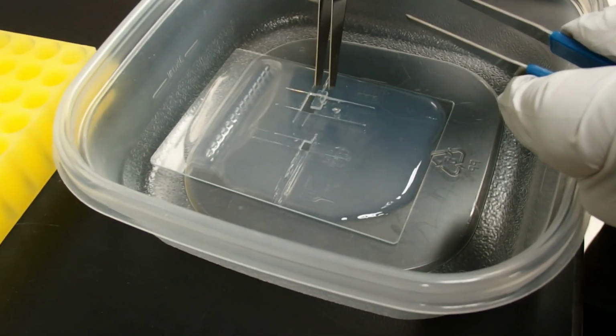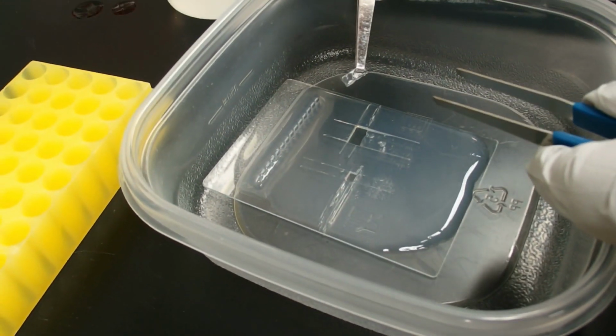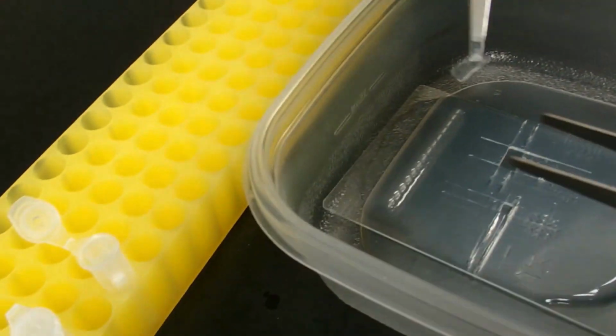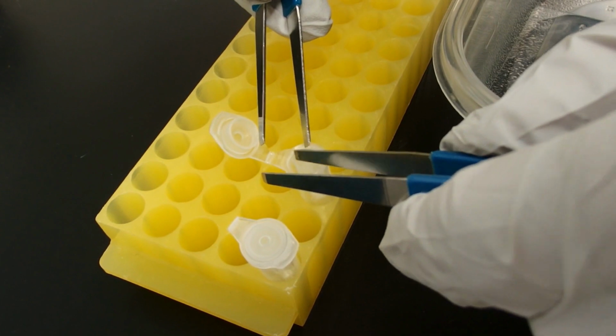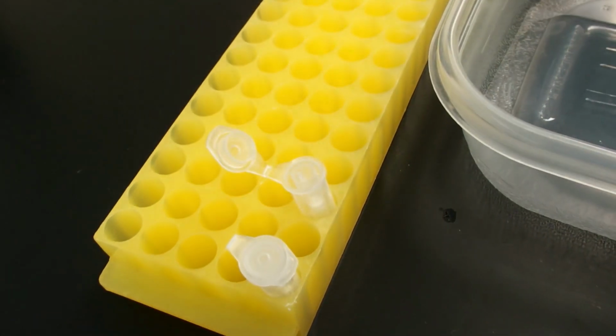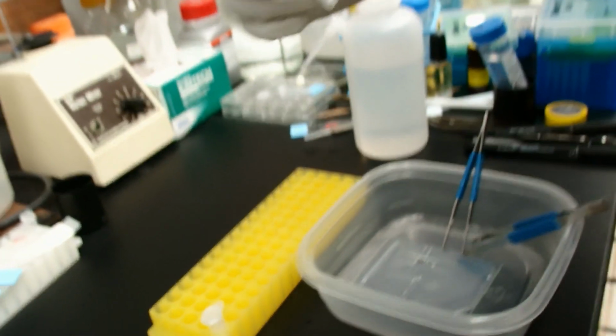We have this bigger piece of gel here that wouldn't fit into the smaller reservoir cup, the 10 microliter pipette tip. So we'll put that into the 200 microliter pipette tip. Again, it doesn't have to go all the way down in there. Close that up. Okay.